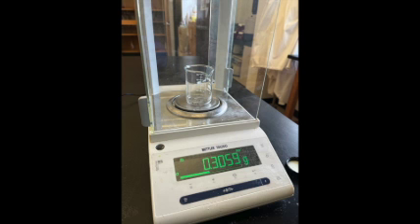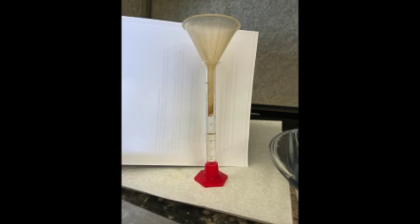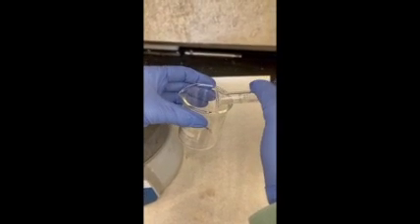You will begin by using a 50 milliliter beaker to weigh out approximately 0.30 grams of pure copper metal. You will do this on the analytical balance and be sure to record every digit. In the hood, add approximately 5 milliliters of concentrated nitric acid. Make sure you are wearing gloves.